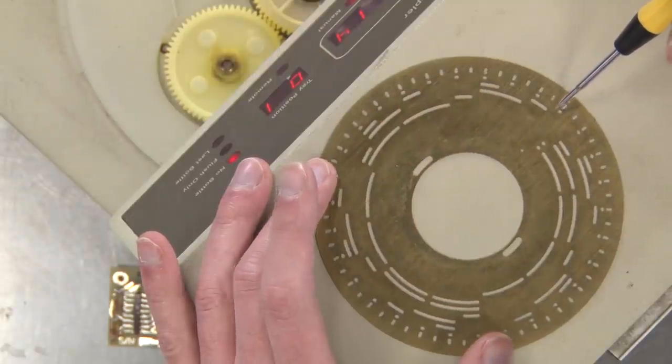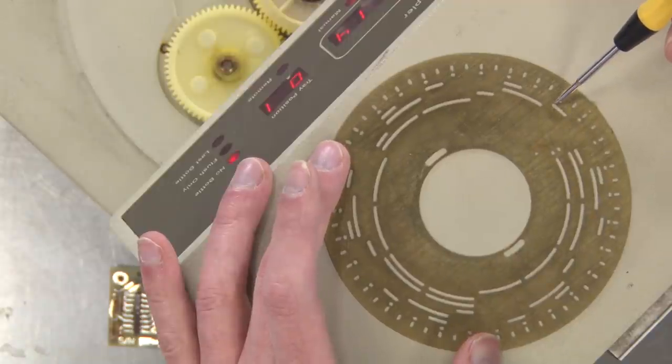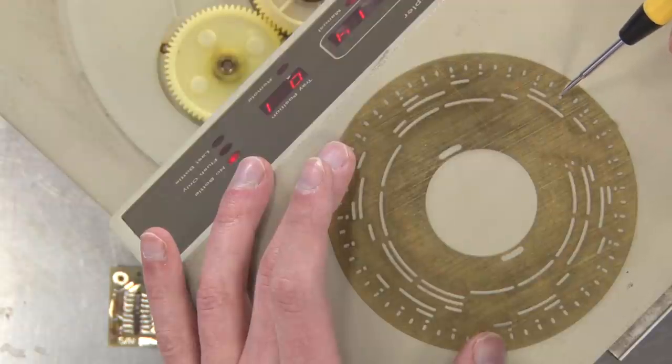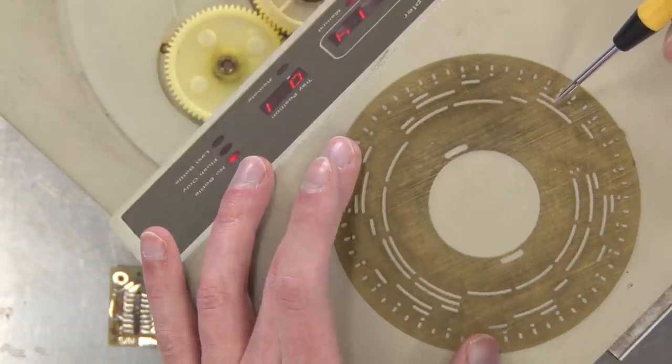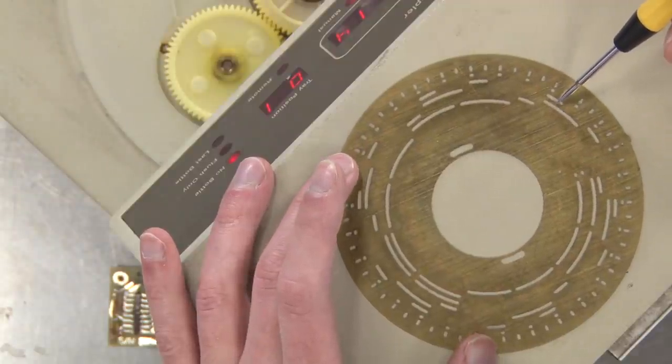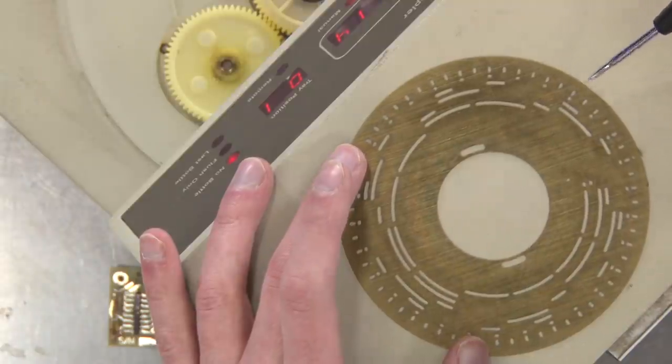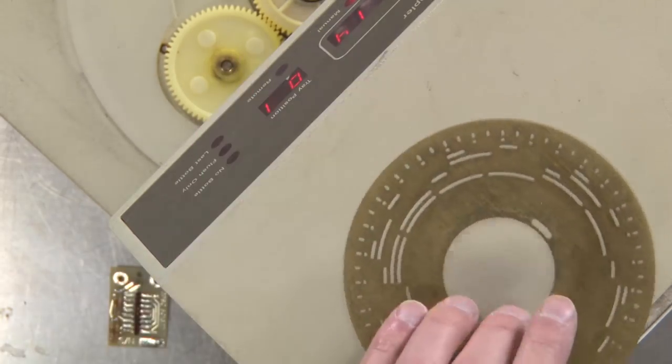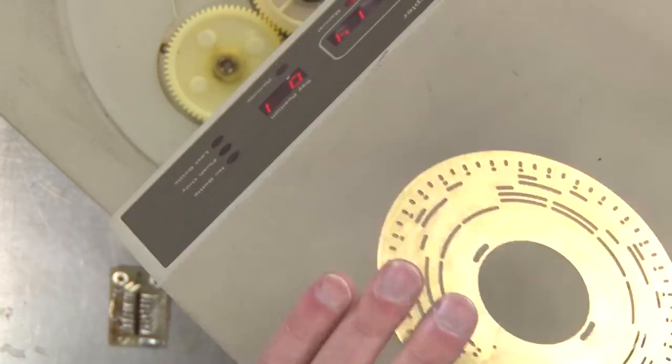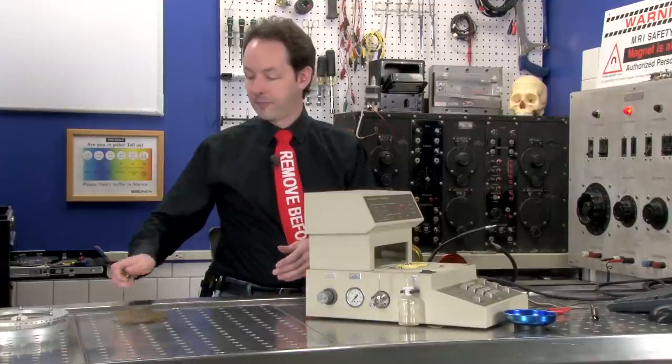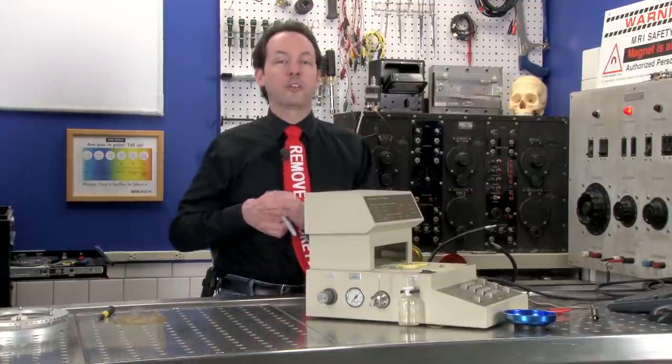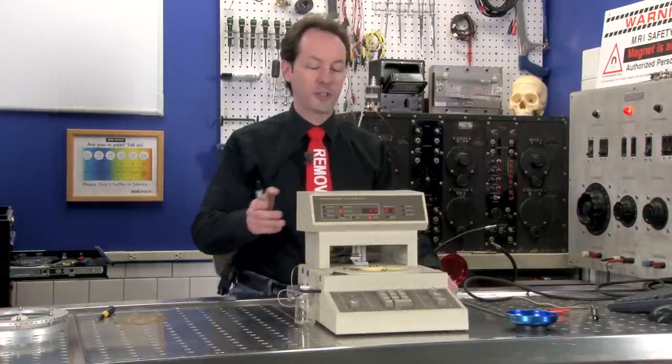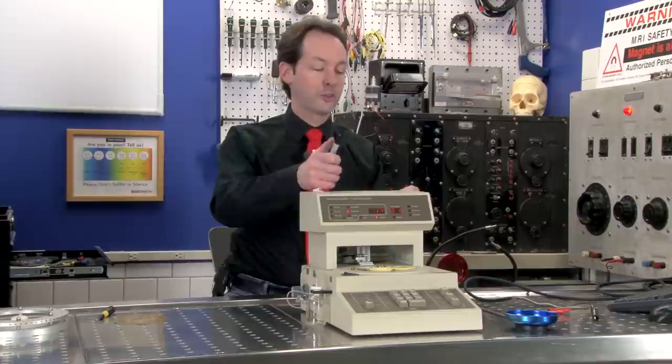Wait, wait, wait. And the next one over here for two. And then both of these for three. It is binary. Because we've got one, two, two plus one is three, four, four plus one is five, four and two are six, four and two and one. So, this is binary. That's kind of cool. We have a binary counting wheel.